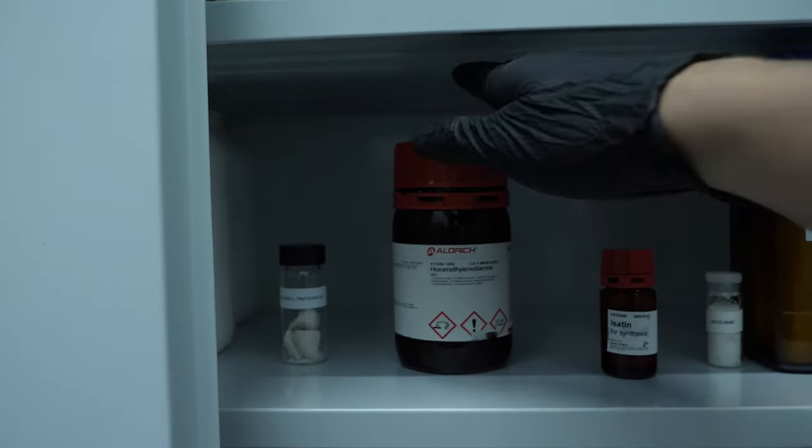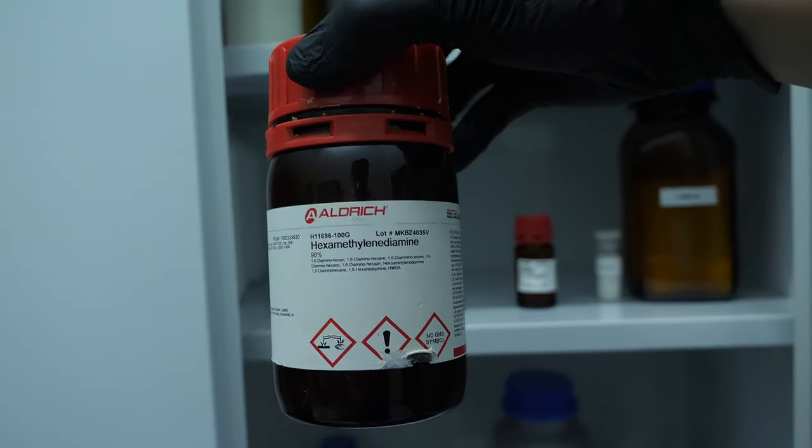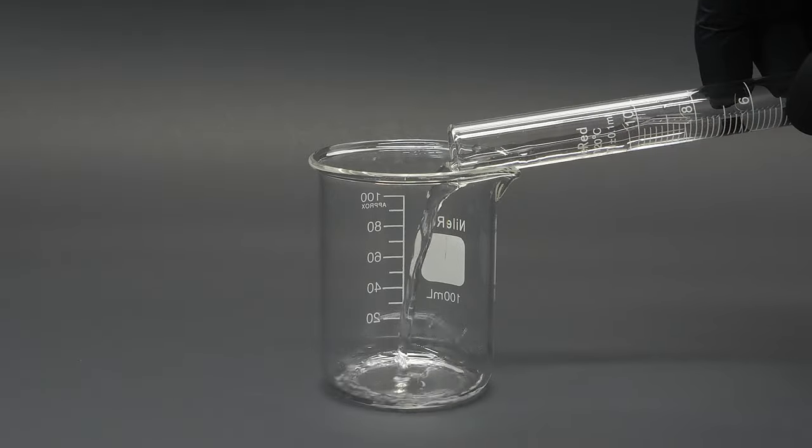A little while ago, I dissolved something called hexamethylenediamine in water and I added it to a beaker.